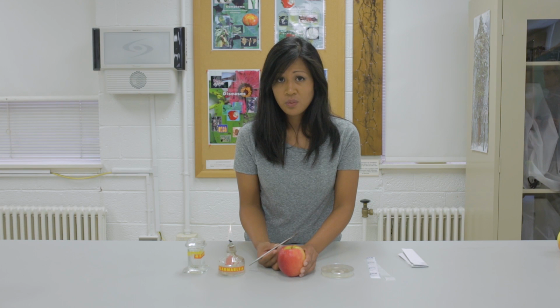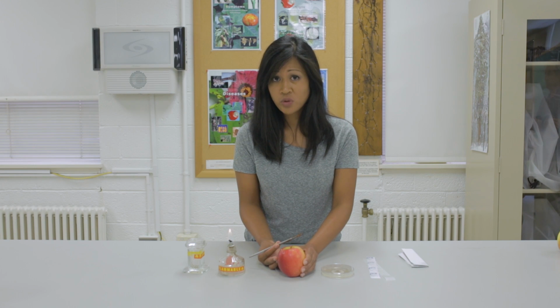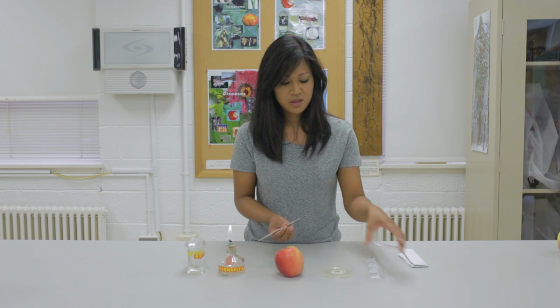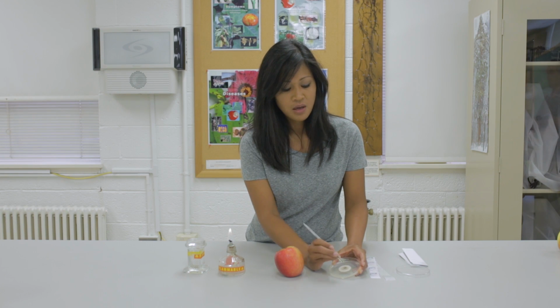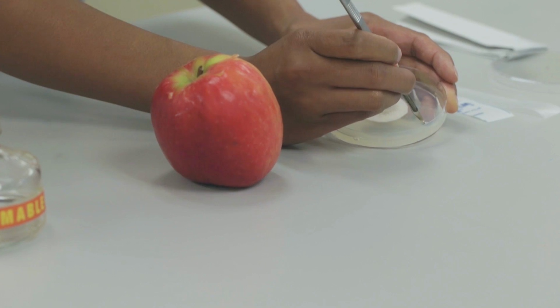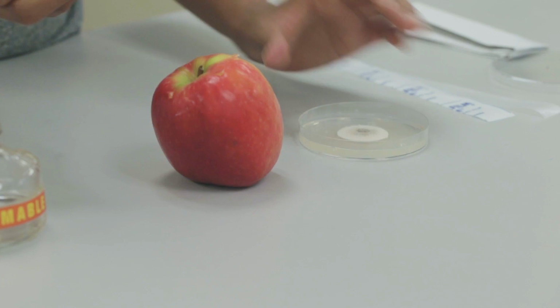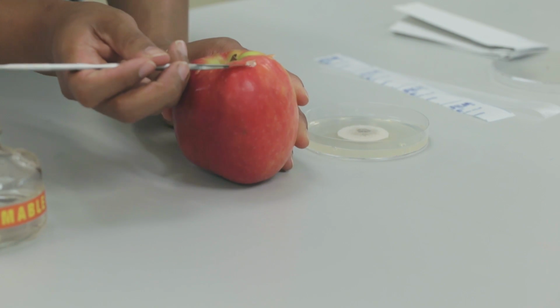Now in one of the wounds, we are going to put clean agar that does not have any organism growing in it. This will serve as our control to ensure that any effects are caused by the organism and not by any of the procedures that we are performing. So take a small piece of agar away from the colony, and then carefully place it in the wound.